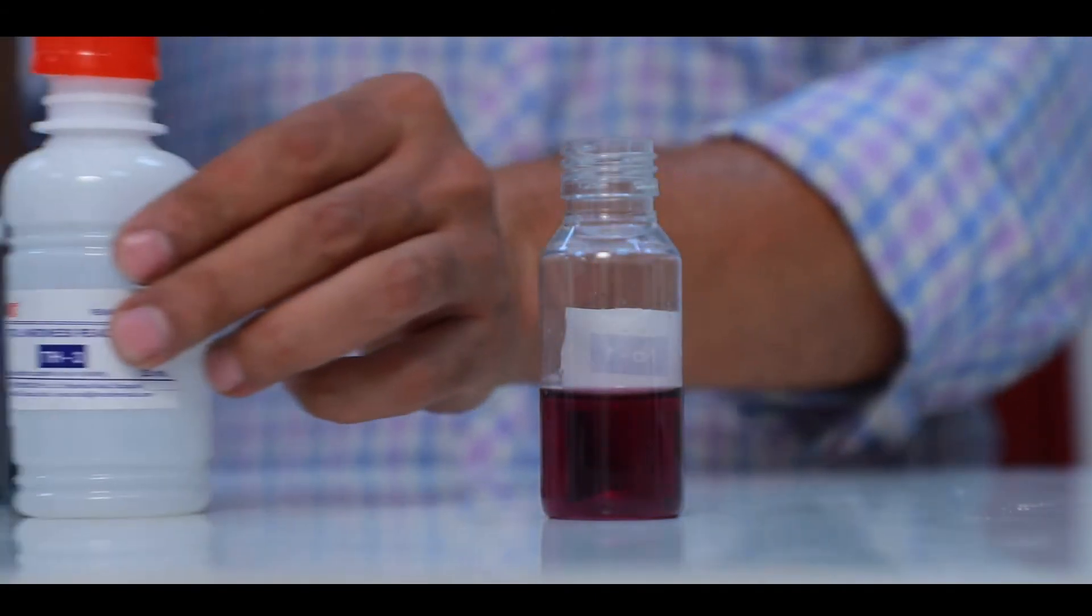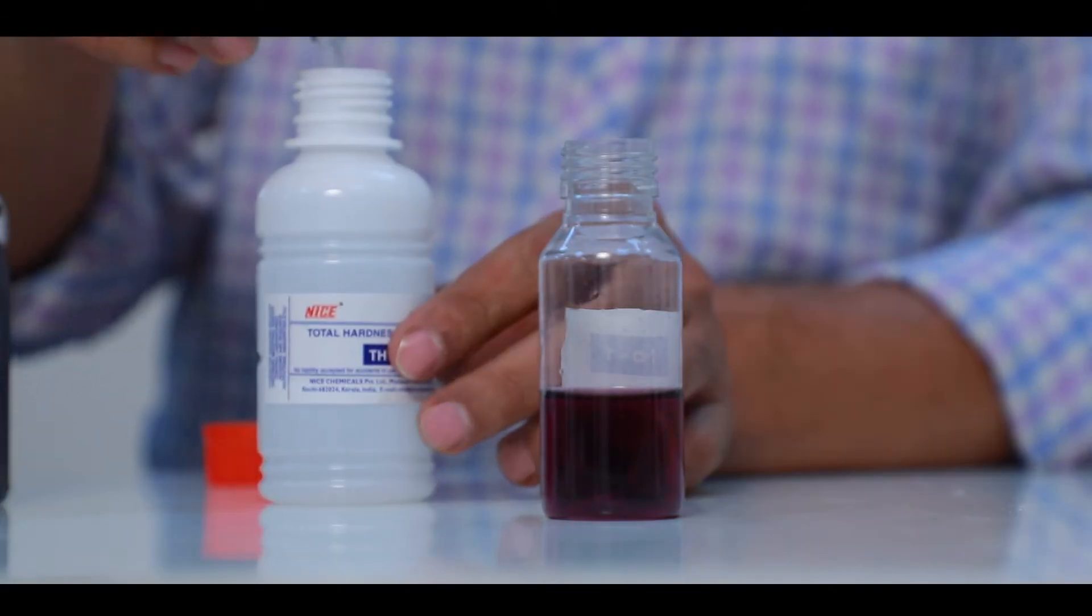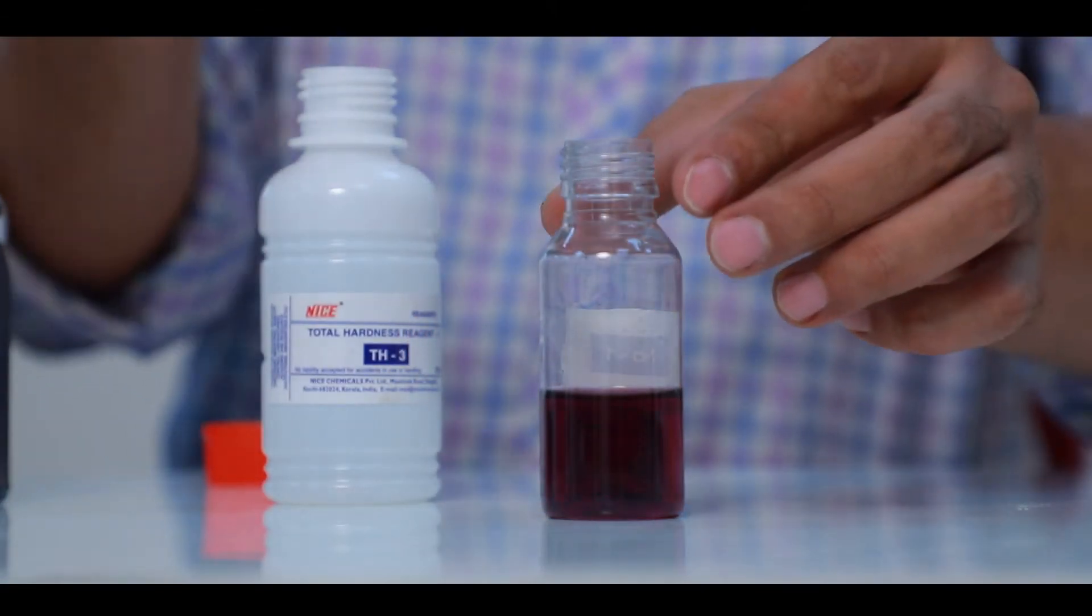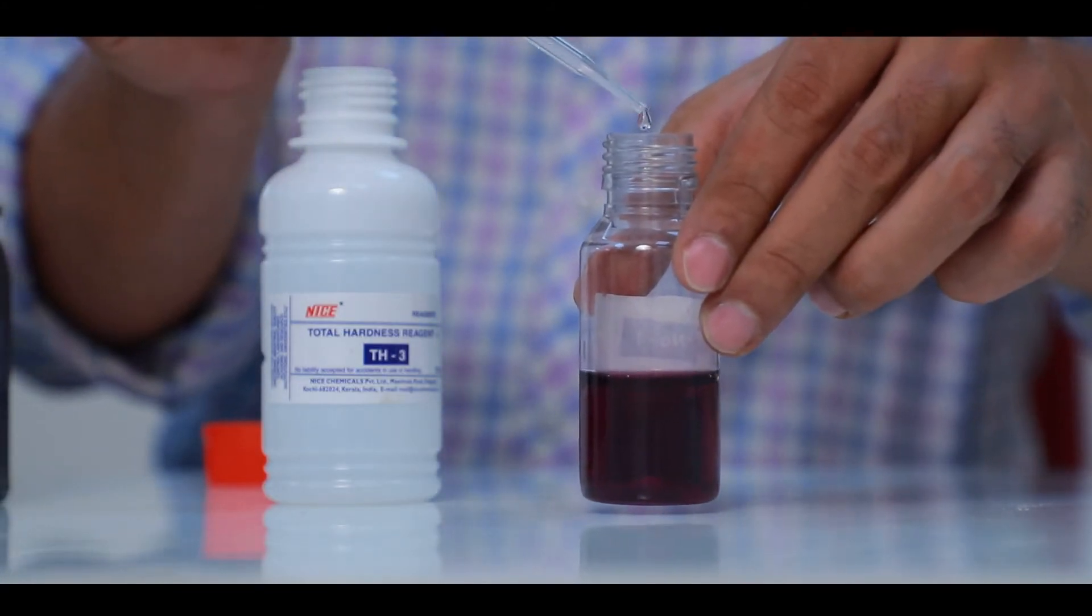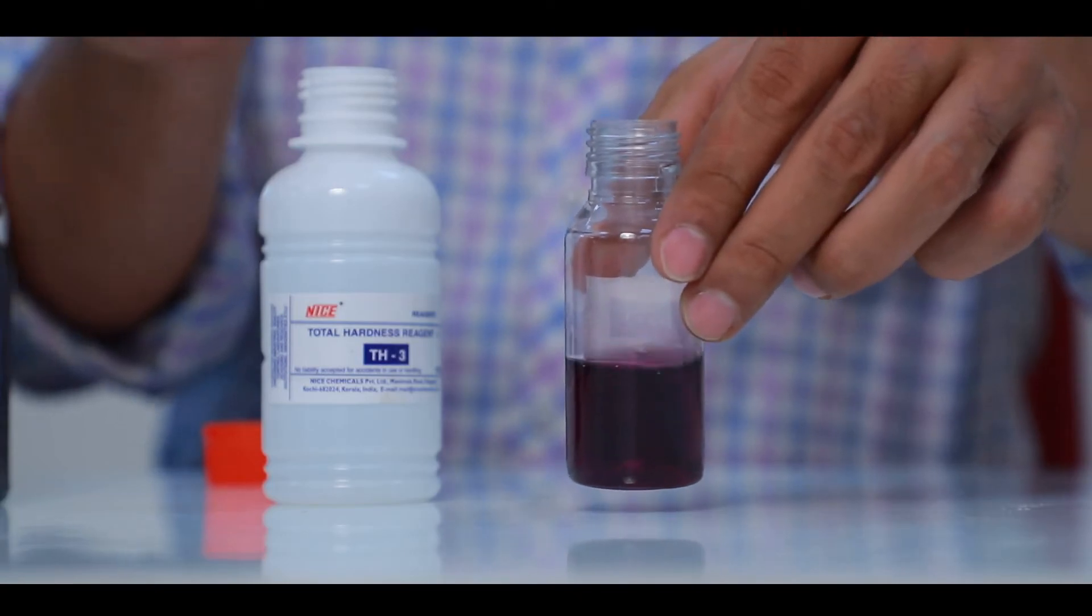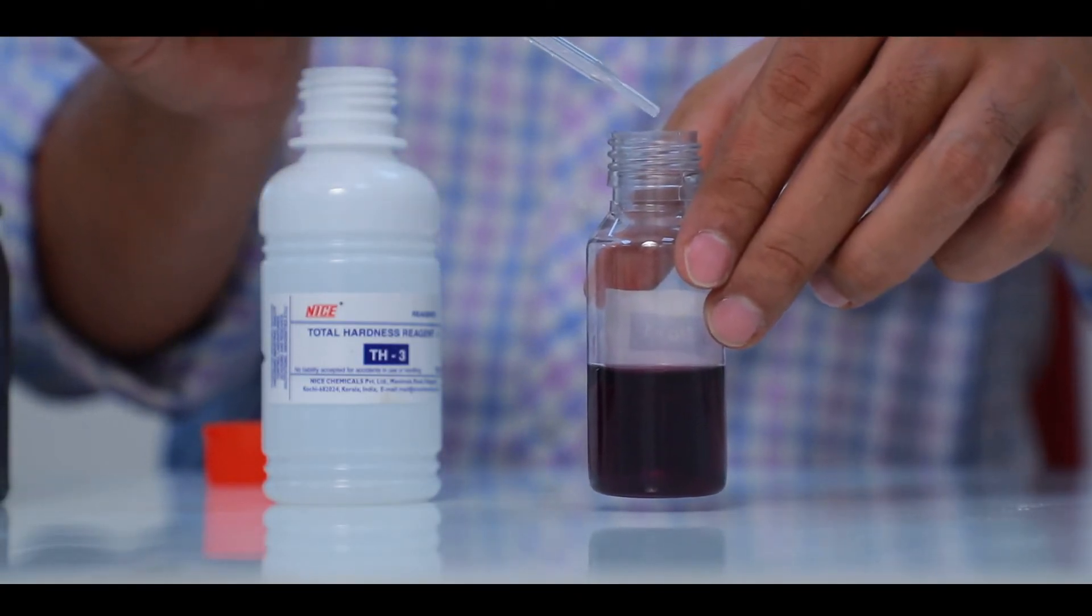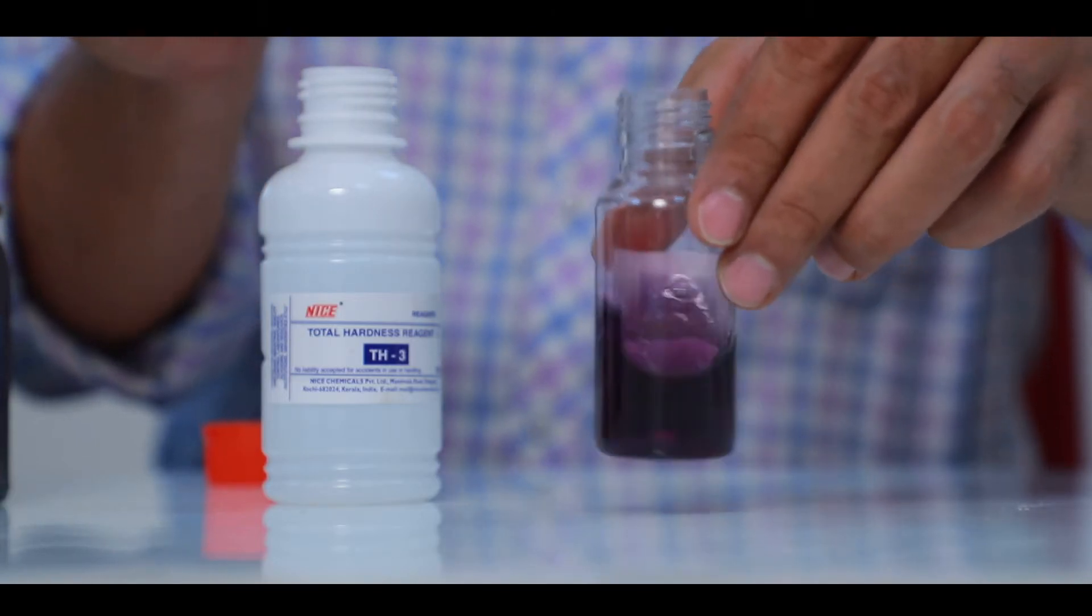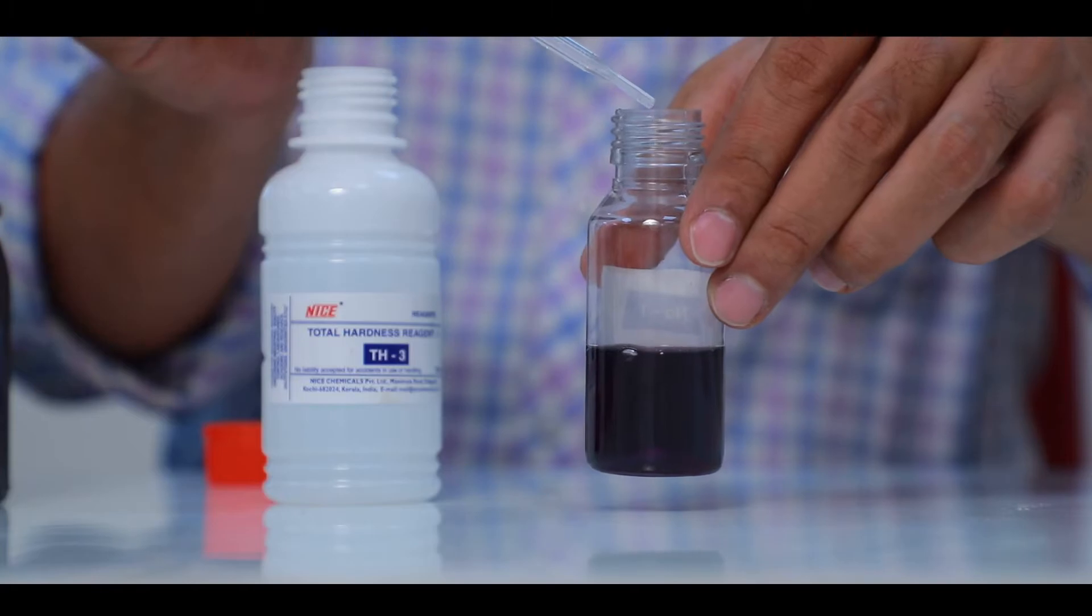Add Total Hardness Reagent 3 dropwise. Shake well after each drop. Count the number of drops of Total Hardness Reagent 3 until the colour changes from pink to blue.